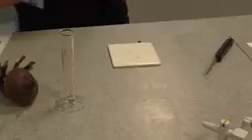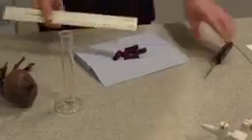The next thing you need to do is blot those dry, and get yourself a ruler and a scalpel or some kind of blade, and cut yourself 5 little chips of beetroot tissue, and make them all the same length, so they should be as similar as possible. We need to make sure they've got the same surface area if we can.